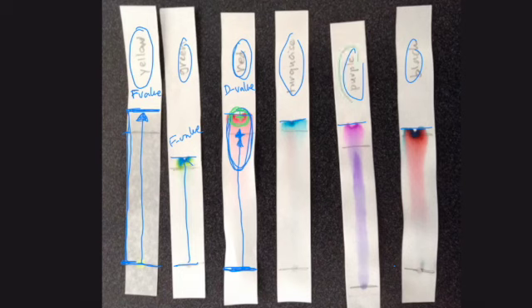For instance, purple we'll look at has two individual color spots, this pinkish and this purple, which is very spread out actually. So I'm going to draw two circles for two different individual color spots, with a plus sign in the middle of each. And then to measure the D values, there are going to be 2 D values for that purple: measuring from the starting line to this plus sign, and then the starting line to that plus sign. So for these that have more than one color, you're going to have more than one circle, more than one plus sign, more than one D value.